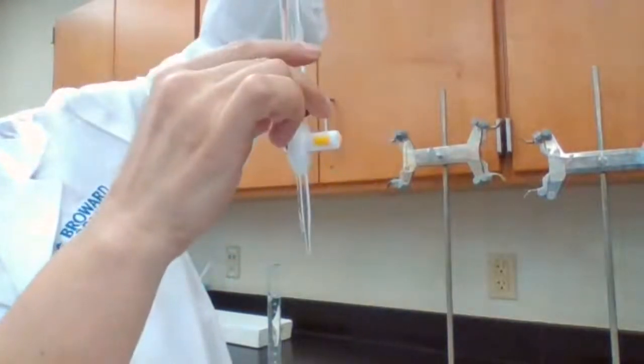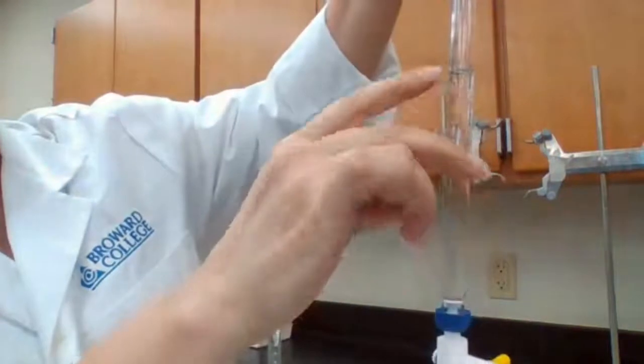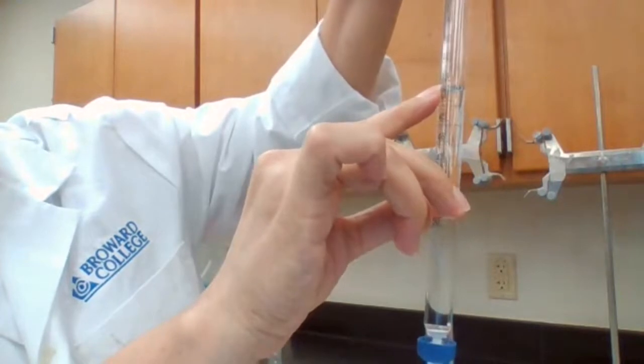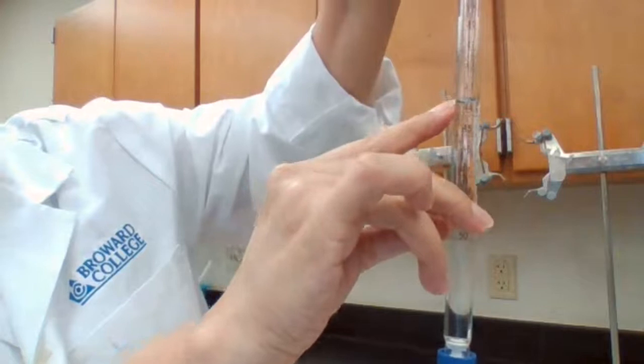So 43.1, .2, .3, .4. If I read this number from the top, it is 43.4 and exactly on the line.